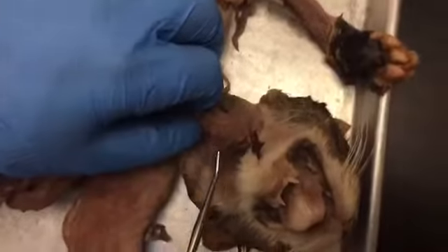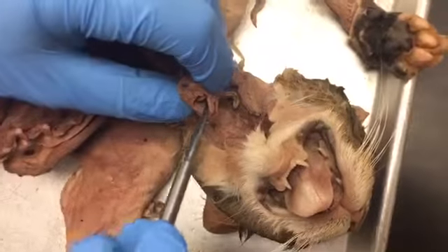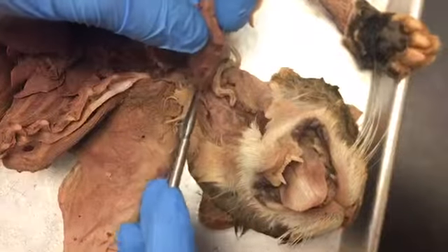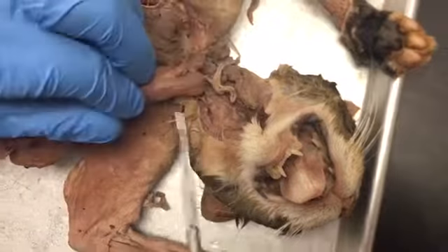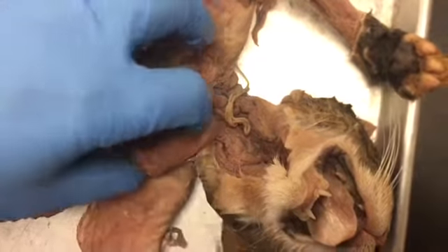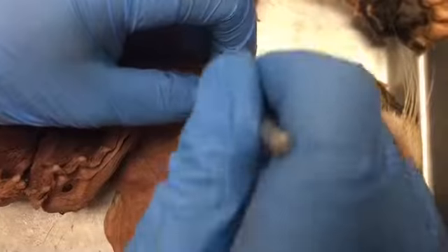You have the larynx. You have the trachea. And the trachea down in here is the epiglottis. On the back side of the trachea, we have the esophagus, which you can see if you go like this, you'll be able to see that the esophagus runs down here. Inside, we have the trachealis muscle, which is right here. Inside the pharynx, obviously, you have the trachea and the esophagus.